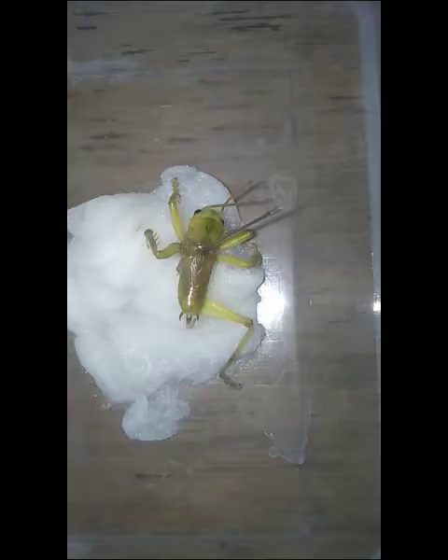And now let's have the dissection of the two insects that I have preserved. So let's start with the grasshopper and next is the spider.